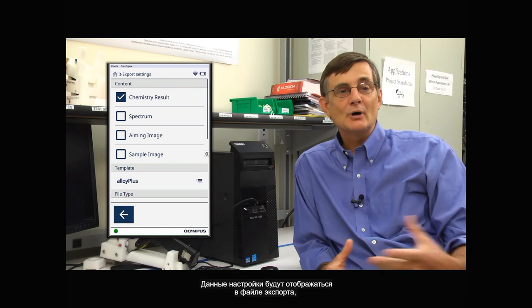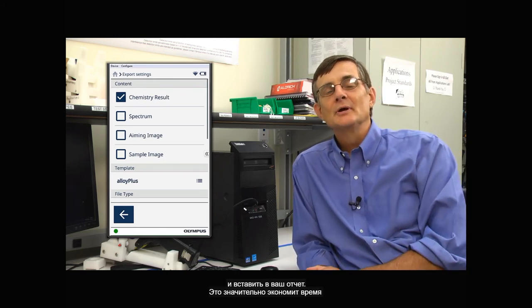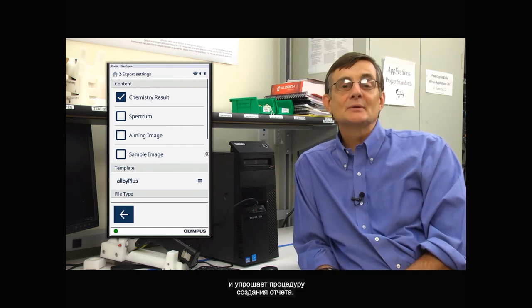Those settings will show up in your export, so now you can just cut and paste from that export into your report, saving time and effort when it comes time to make that report.